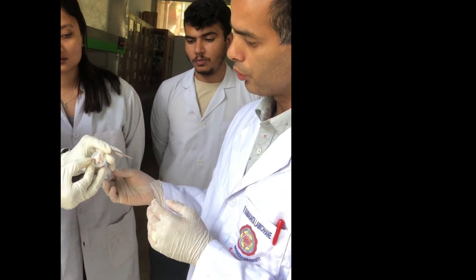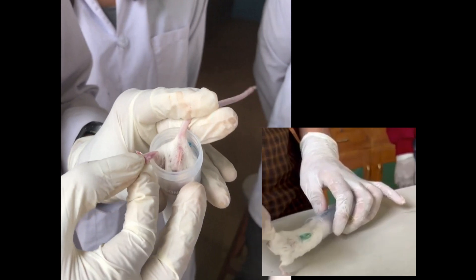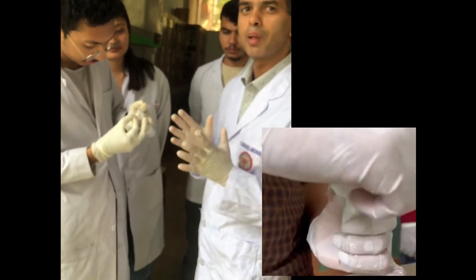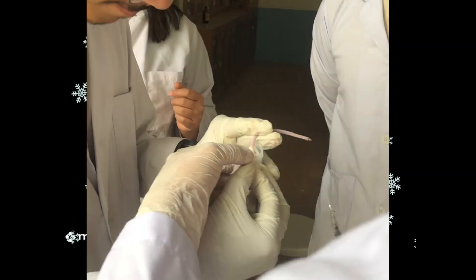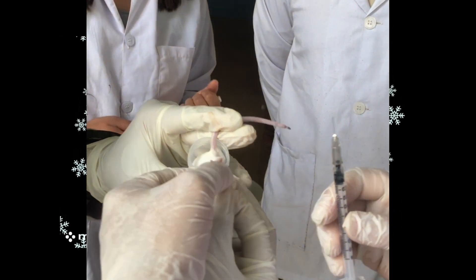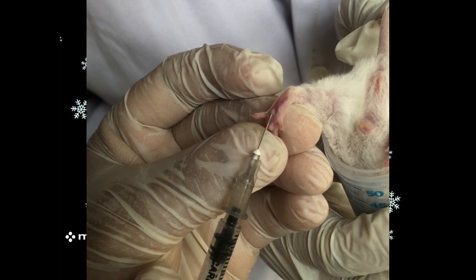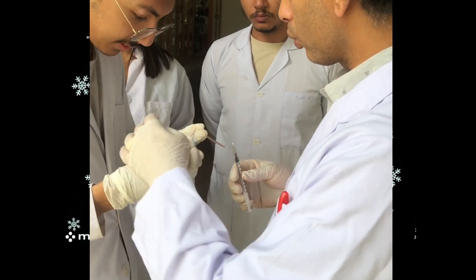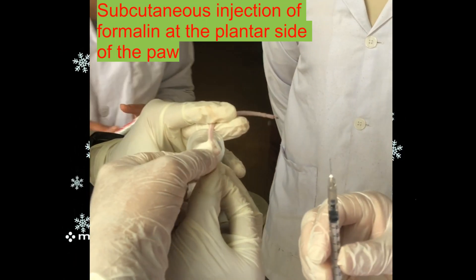Here we are using a falcon tube into which the mice will go inside easily, so we can hold the leg and restrain the animal properly, as you can see here. We are going to administer a subcutaneous injection.